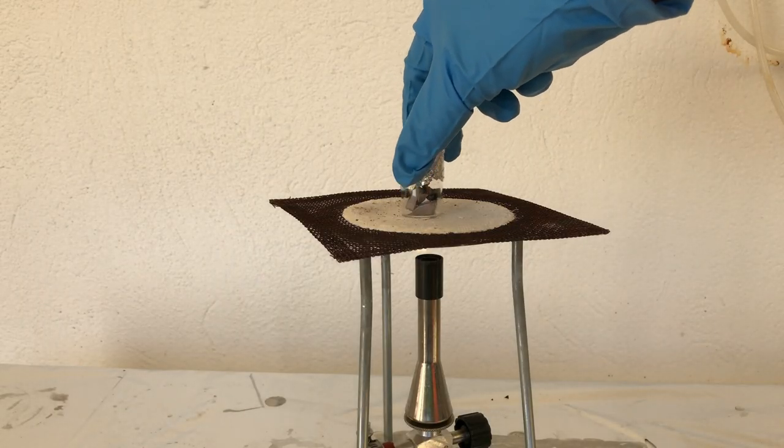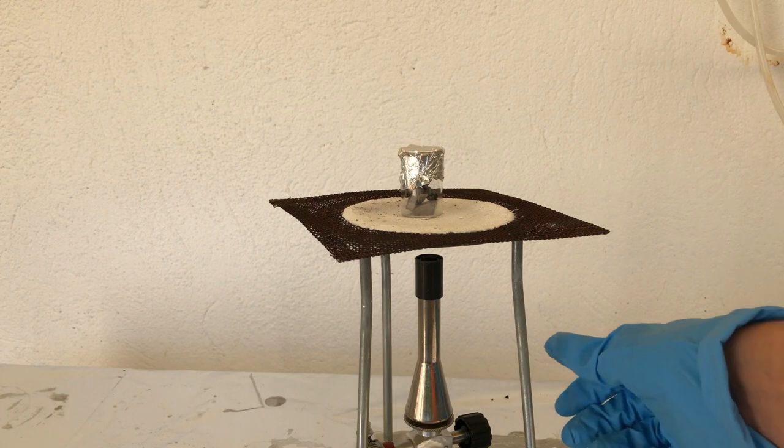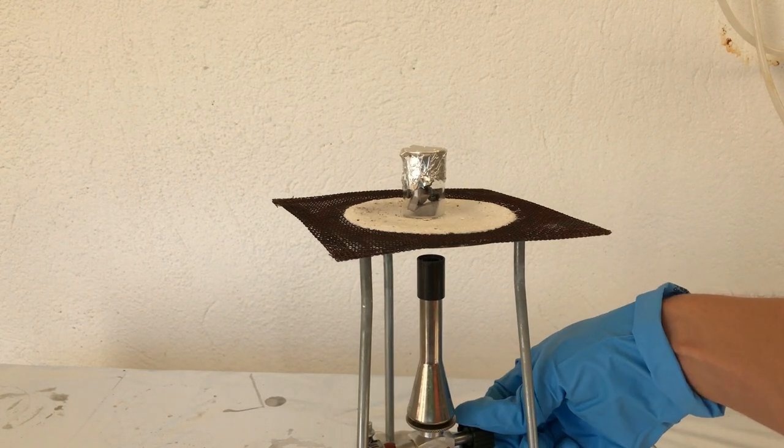Afterwards, the mixture was heated up using a Bunsen burner. We heated it until an even mixture was formed.